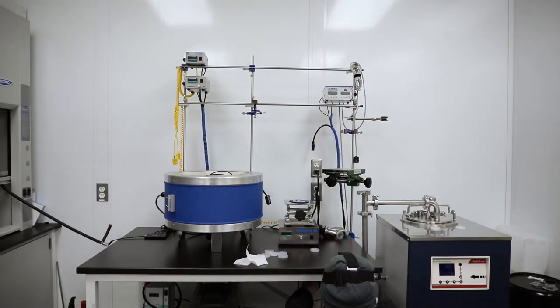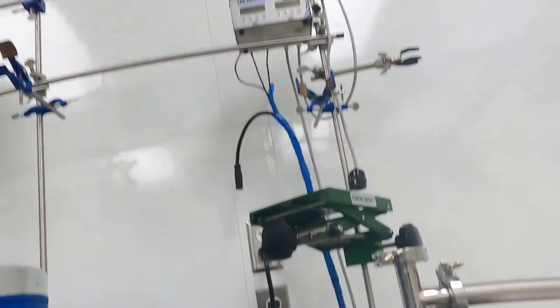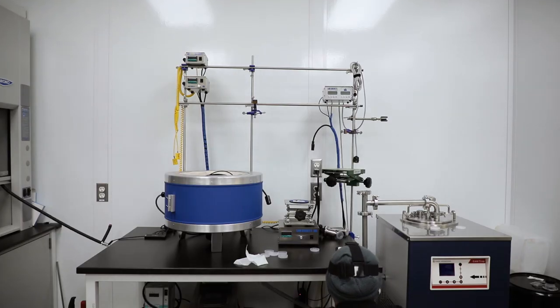I've got my sensor wire right here so I can plug this in. This is going up to that PVM2 up there. Make sure all these are nice and tight.